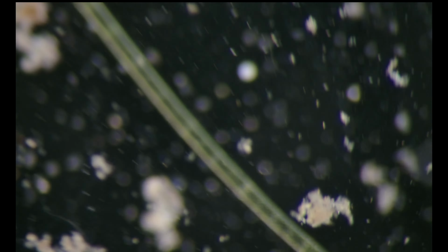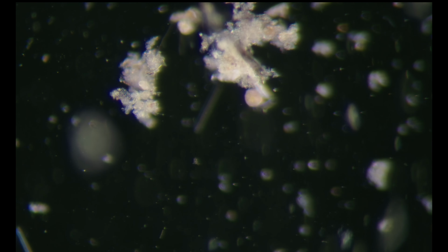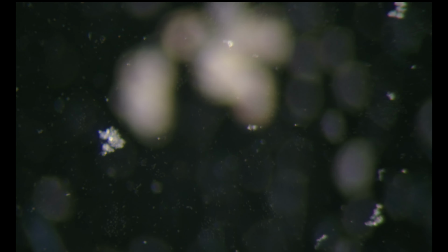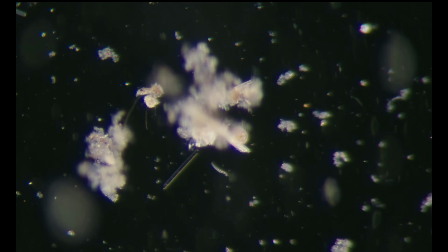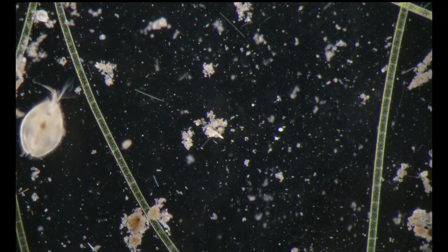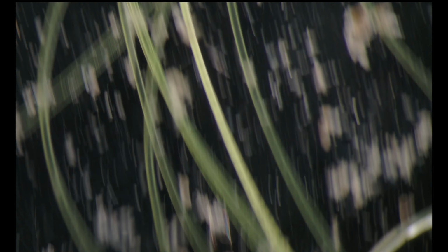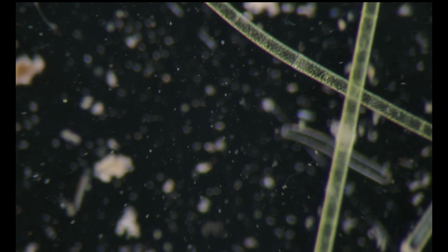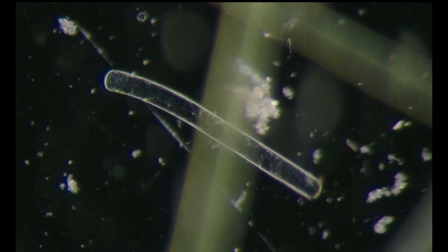Here is an ostracod and a worm, and I've seen here a gastrotrich walking around. Yeah, hey, what's that? It's a globular red one, ciliate. I think it's part maybe of the hypotrich we've seen earlier. But where is that gastrotrich? Here it is, a very tiny one. It's on the debris now.